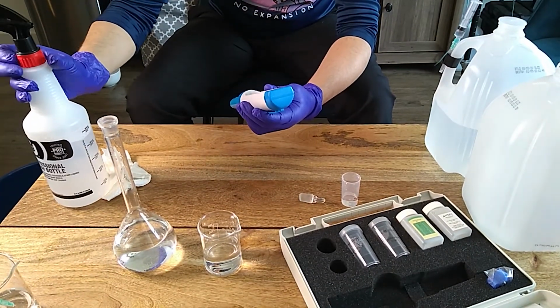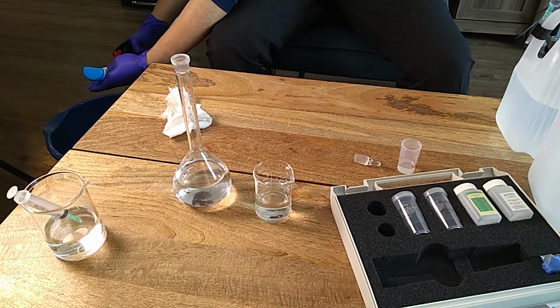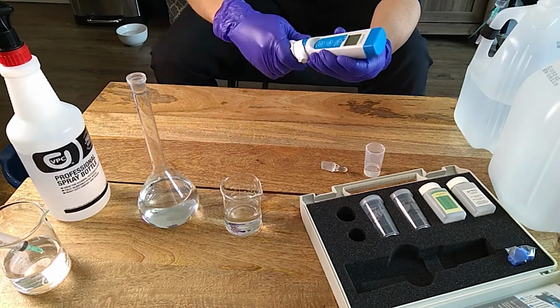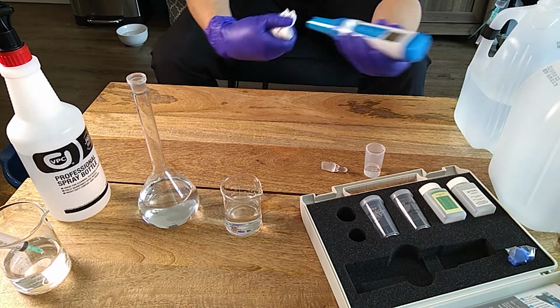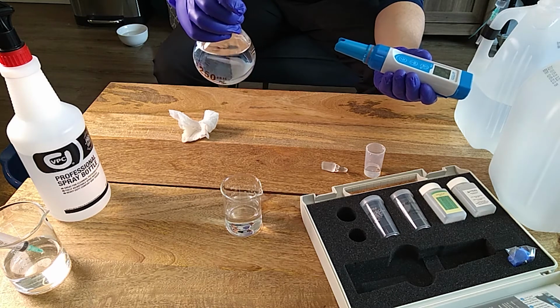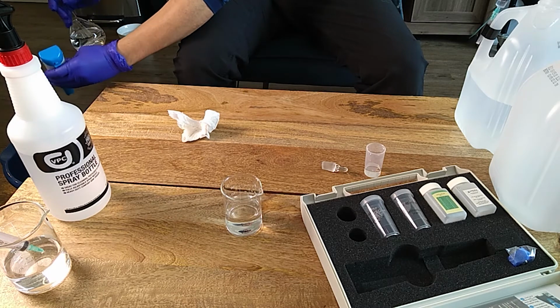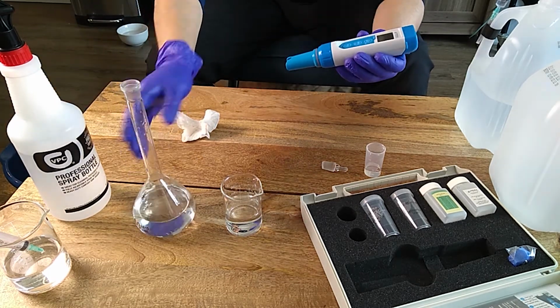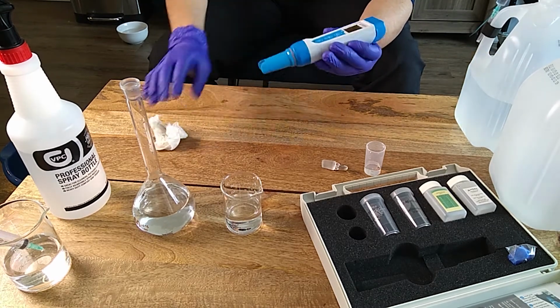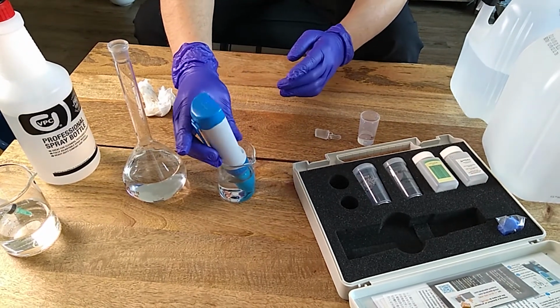And I'm going to just spray it with a little bit of distilled water. So I spray the electrode with a little bit of distilled water and I'm gonna clean it. If you want, you can also wash it with a little bit of the solution. So you just rinse it with some of the solution. I'm doing this off camera because the bucket is not in camera. So just rinse it with a little bit of the solution to ensure that the electrode gets washed with whatever solution you're gonna measure. And then I just turn it on and put it in there.